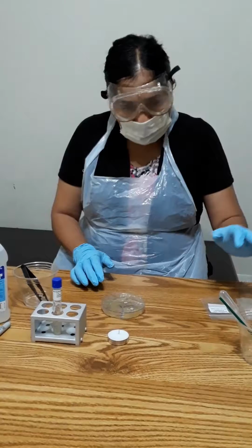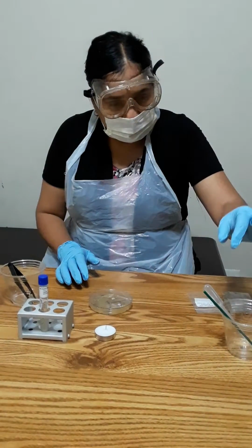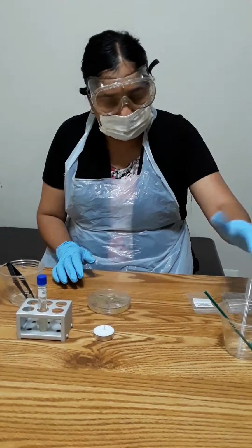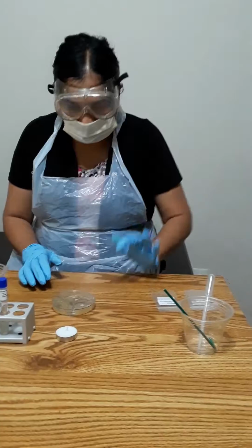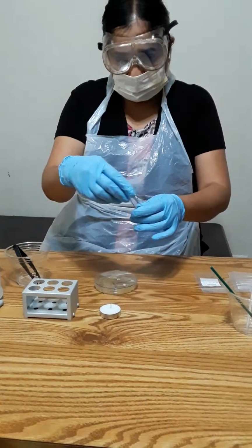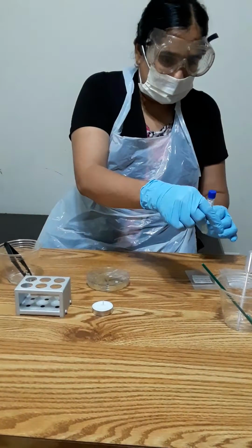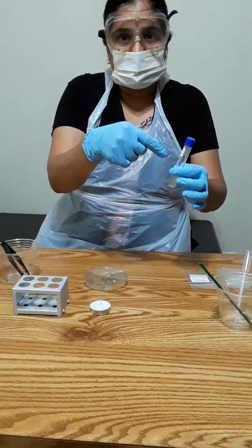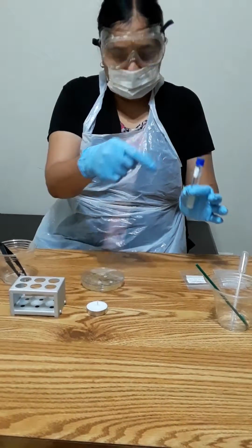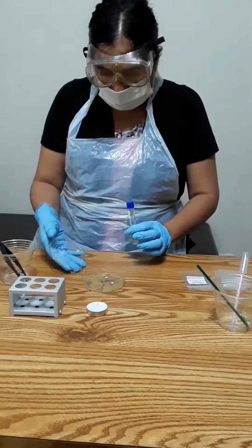One hour before starting the experiment, I had that pipette in alcohol, and these are already used, but I am just keeping them here to demonstrate. So what I did is I opened this and sterilized it, and took the pipette and took out about 0.5 ml of that solution, that broth.